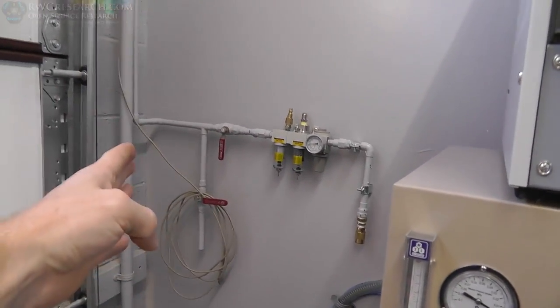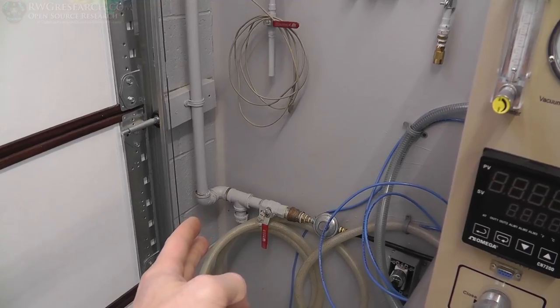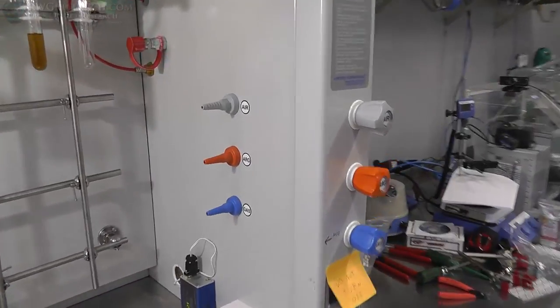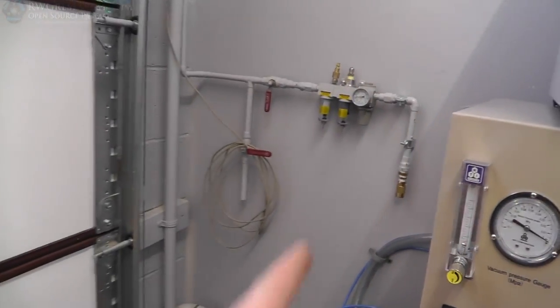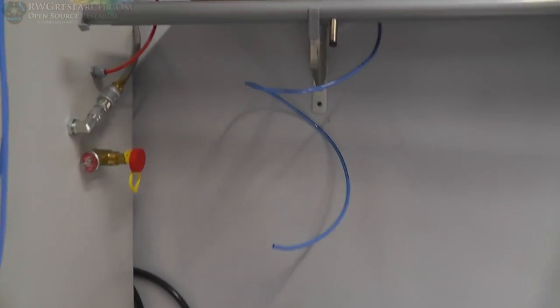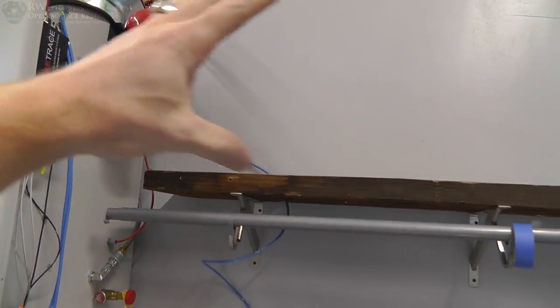So that's the pipe right there. I'm going to connect it to our airline so I can still cut it off. I also can cut the gas off. I always leave those off unless I'm in here. And then I can control them here. The air, I guess, won't be regulated unless I add a second regulator, which I should probably do. And I don't have one with me, so I guess I'll order one. And then this actually is going to go to the scrubbing system, so it'll be either up here or somewhere.